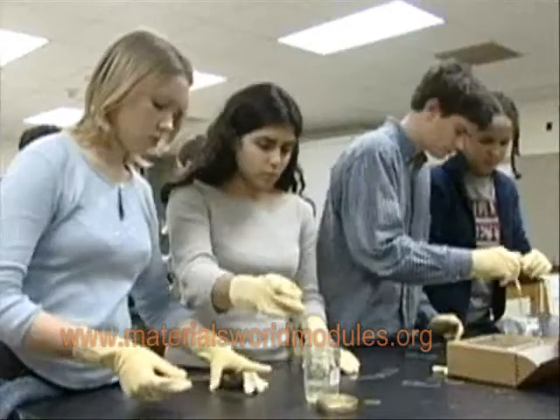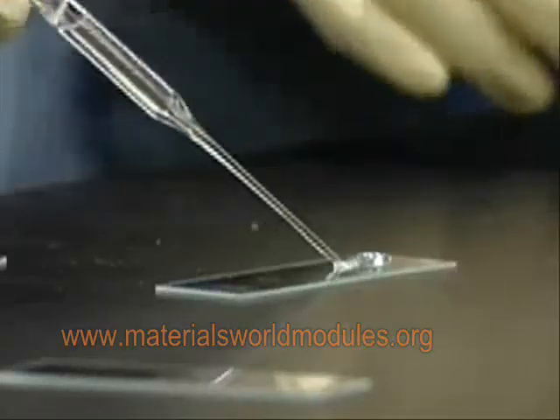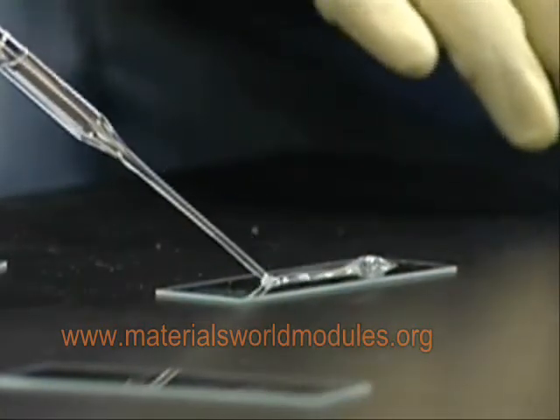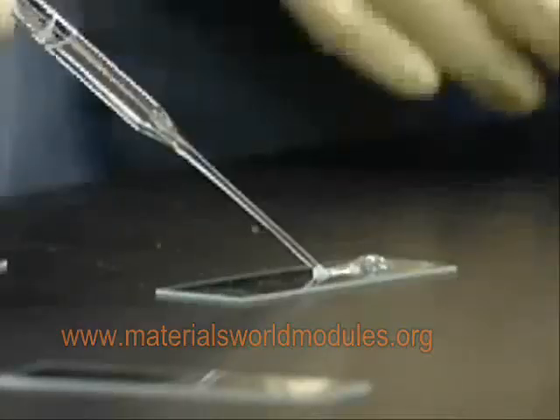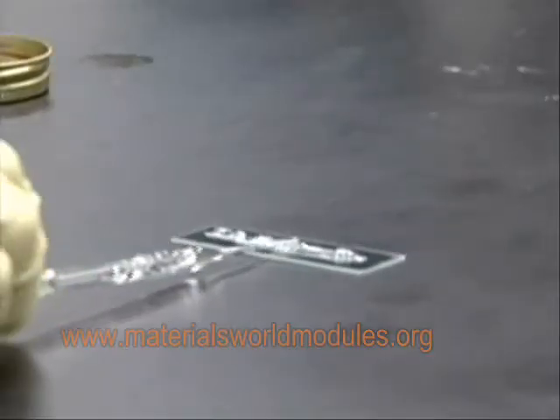The second part of Activity 3 has two goals. The first is for students to continue to see the relationship between molecular weight and now also concentration and viscosity, by comparing the spreadability of different lengths of a polymer at different concentrations. As they spread the polymer on a slide using a pipette, they see that the longer the molecular weight, the more difficult it is to spread. The second goal is that this process is a skill known as casting, which is one of the common ways polymers are applied to surfaces and one way that students may be applying polymers in their design project — for example, applying a polymer to a baseball to try and make it waterproof.